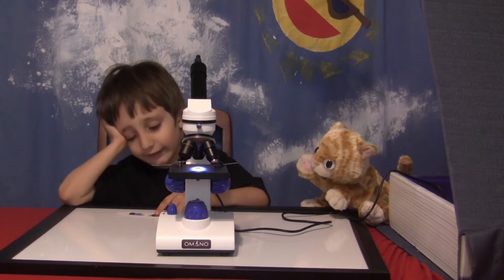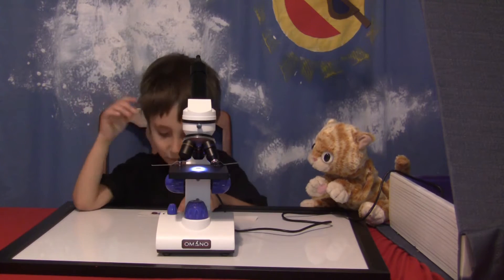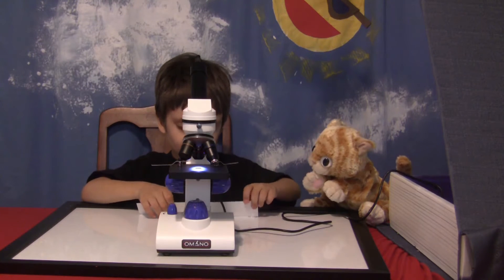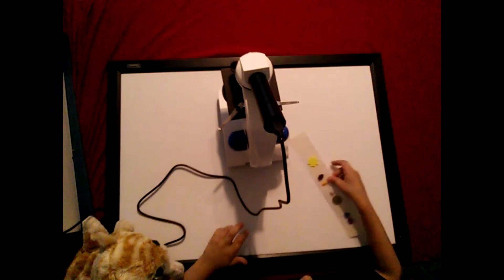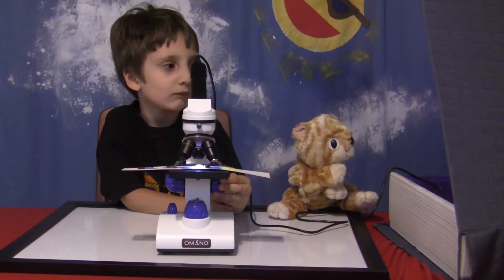Don't take it off when it's sticky. And whoa! What else? And a quarter and two buttons. I think it's a dime. Okay, show it to the camera. I think that one thing is a cheese puff.